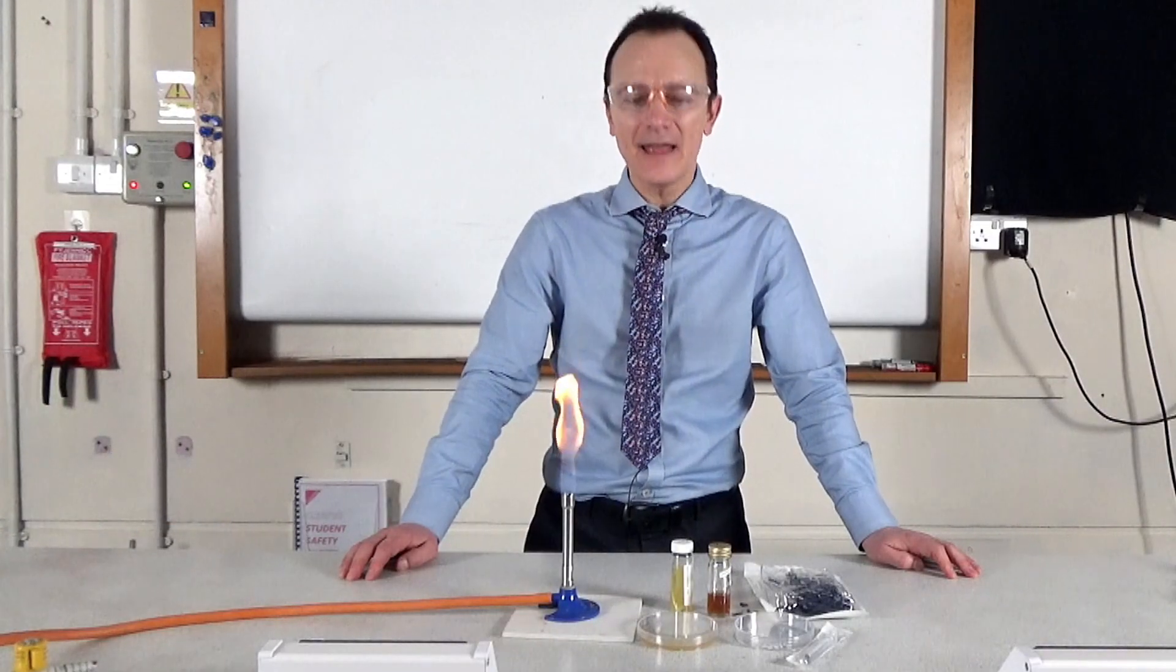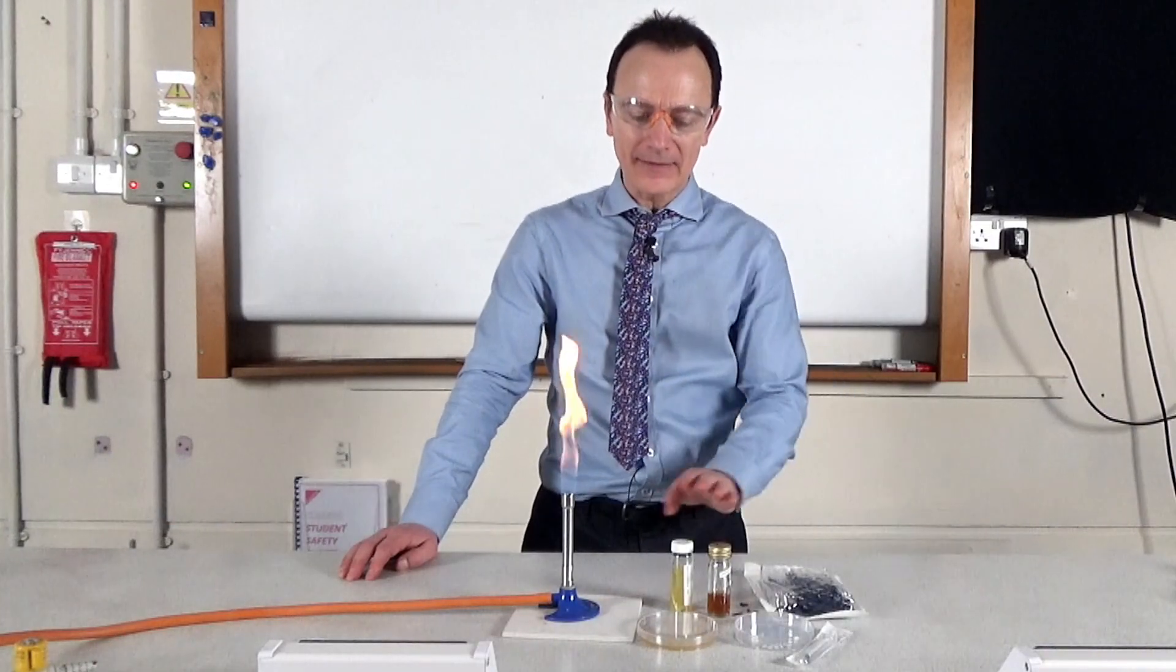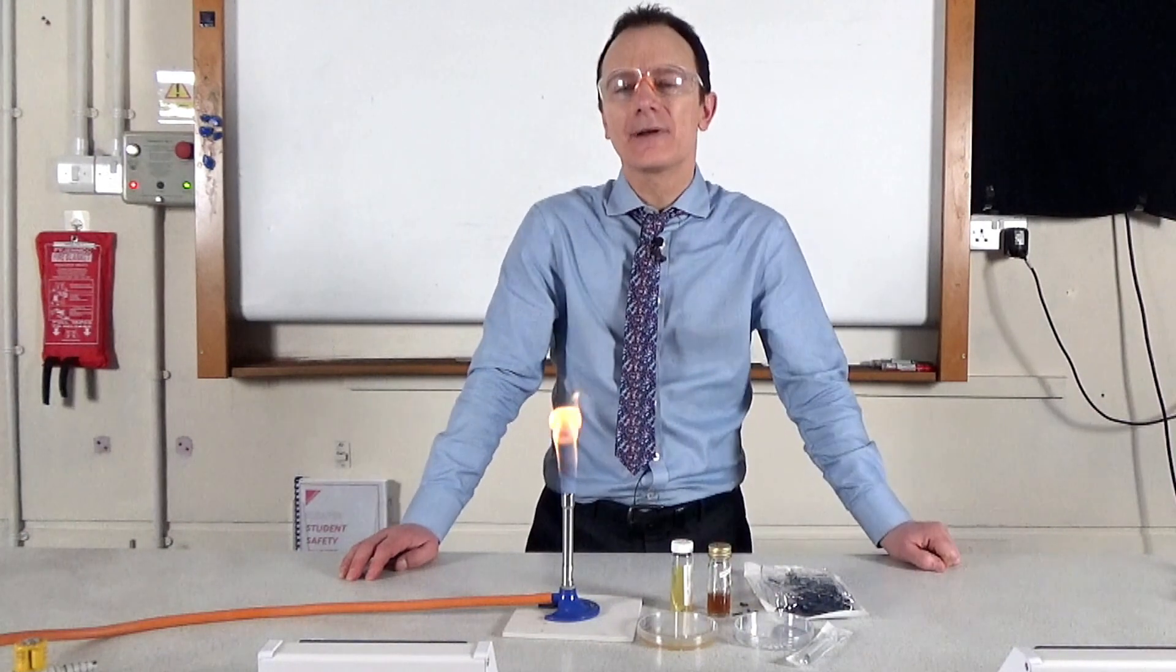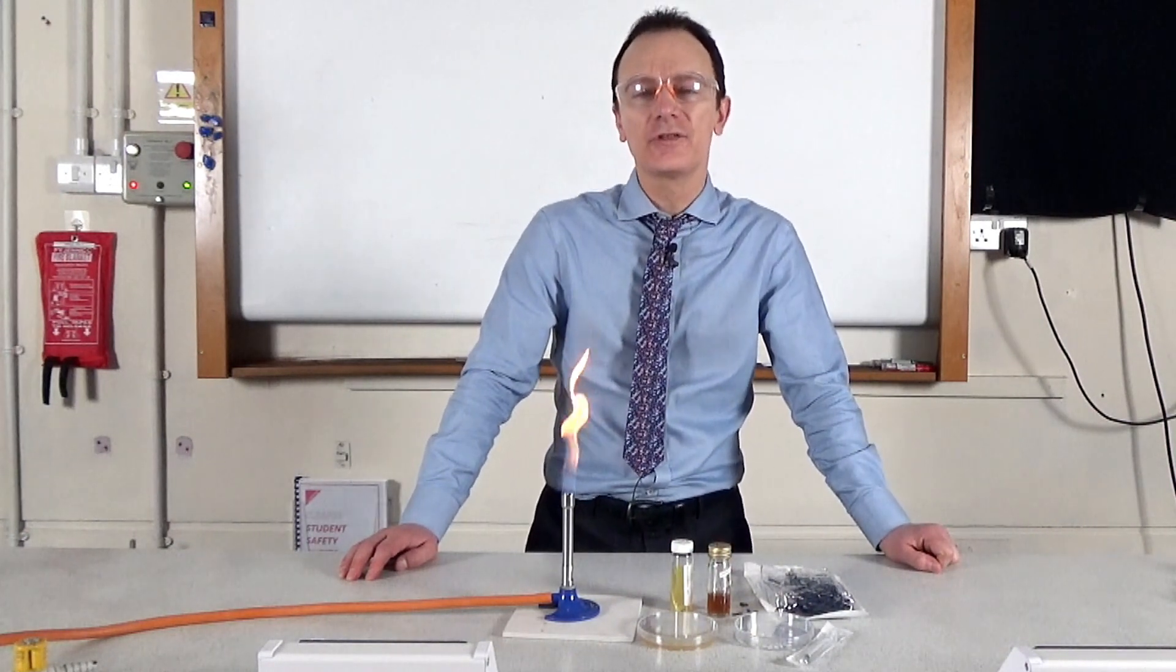Your students then collect their equipment including the bacterial culture and the agar plate and they position it close to the Bunsen burner.